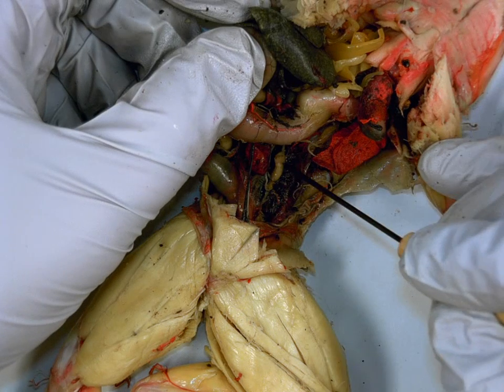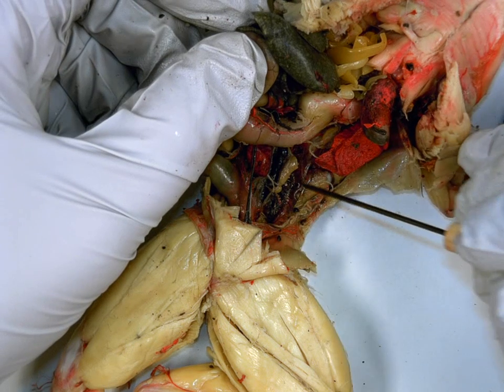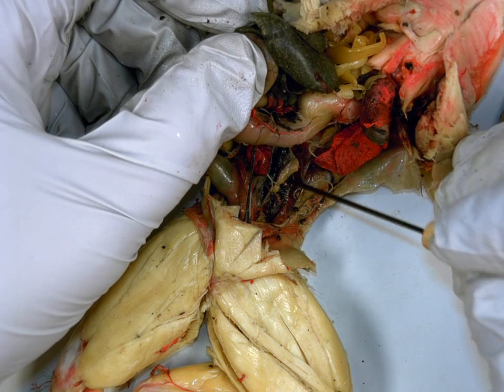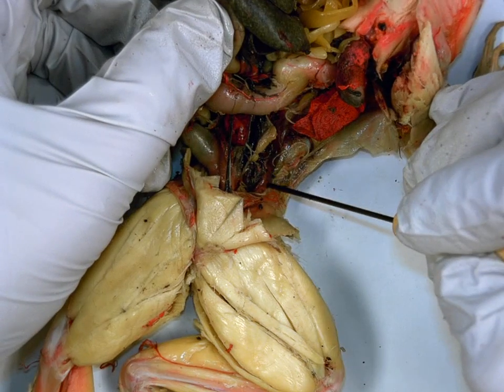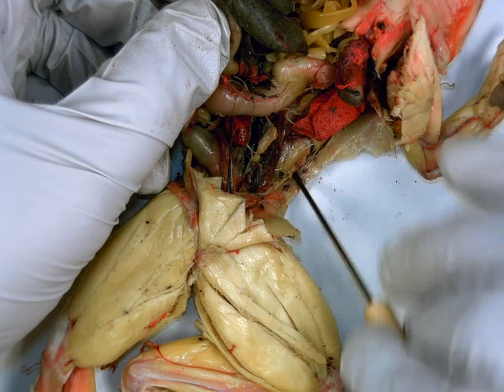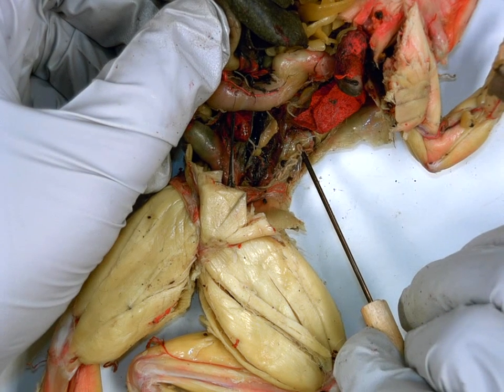But sitting on the kidney is this little kind of creamy colored round organ. What is that? Testes. Function of these testes. Produce sperm and male hormones. So then what are these tiny little coiled tubes to the sides of the kidney? Vas deferens, what's it do? Passageway for sperm.